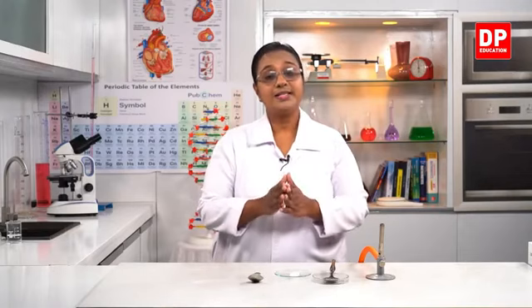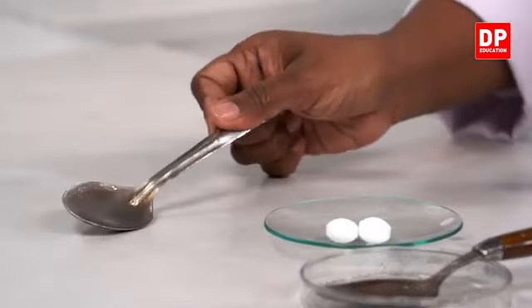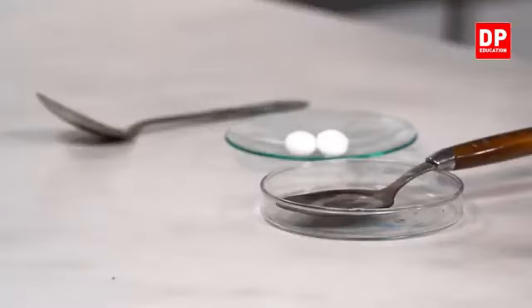So there, what is the change? Solid becomes the liquid, liquid becomes the gaseous state, then the gas becomes the solid. So these are all changes taking place where the substance changes from one physical state to another physical state. Now, if we leave this for some time also, even now you all can see on the surface, the solidifying of the naphthalene. So there it is the solid becoming liquid, liquid becoming gaseous state, and again the gaseous state going back to the solid state.